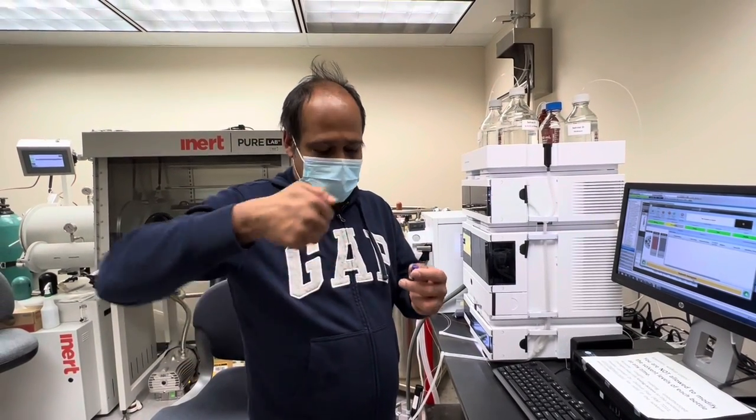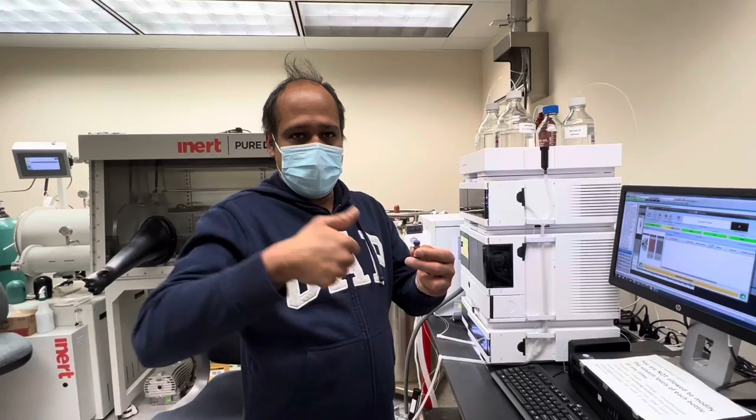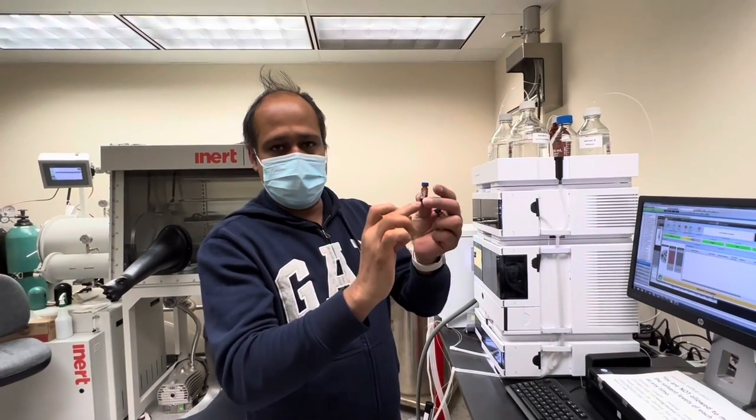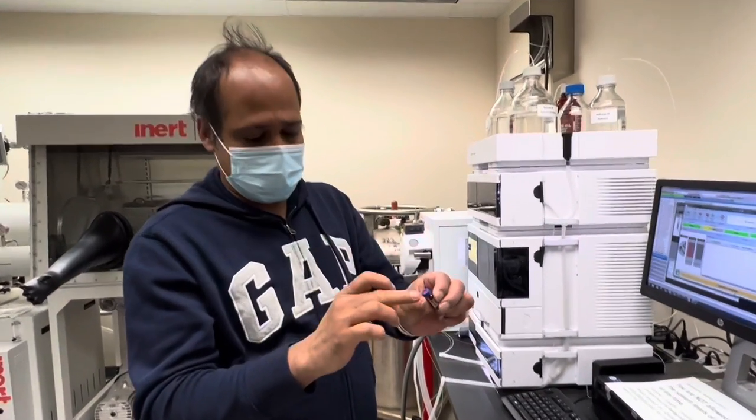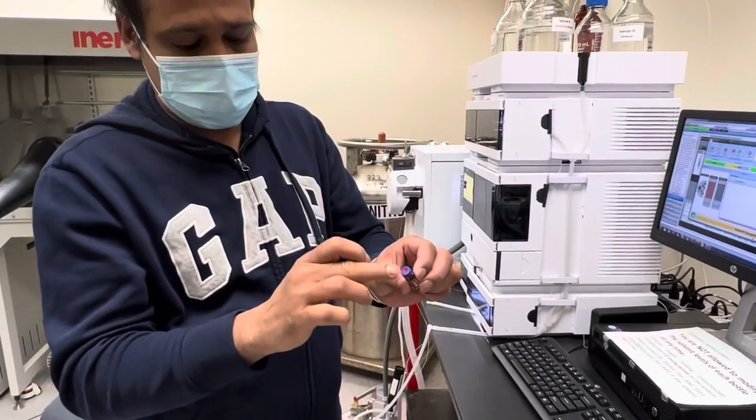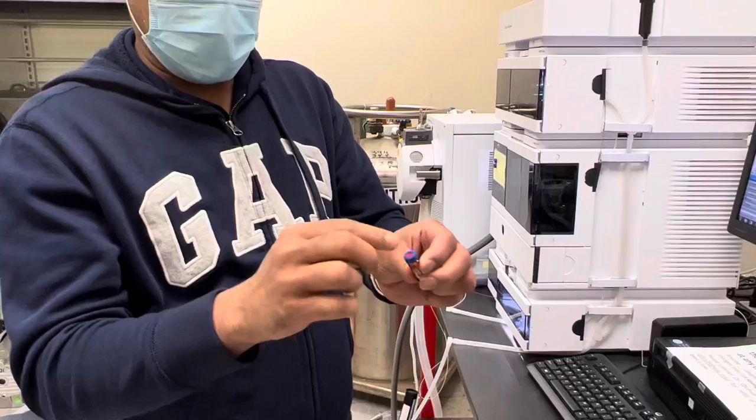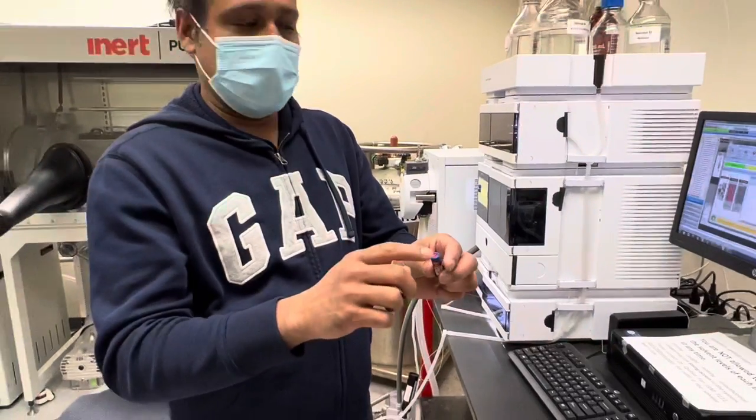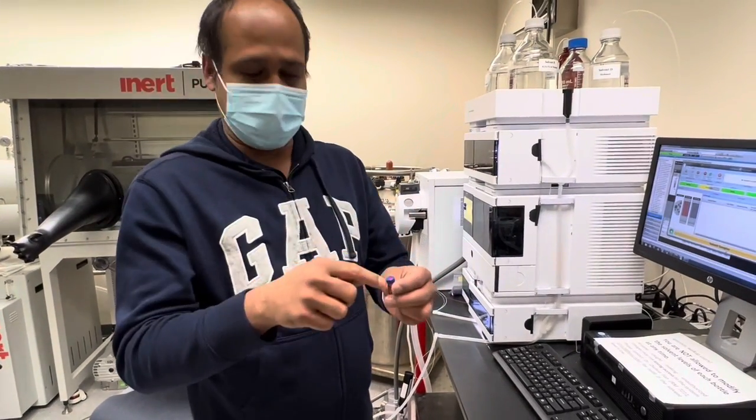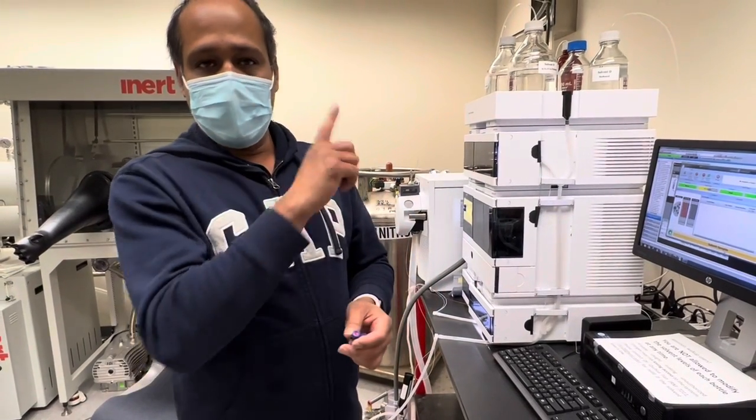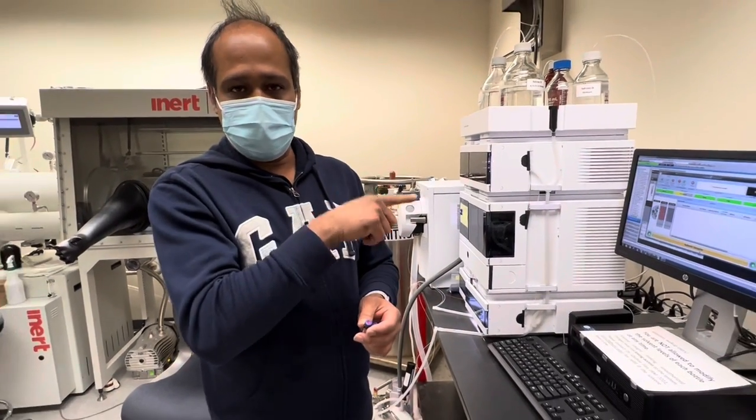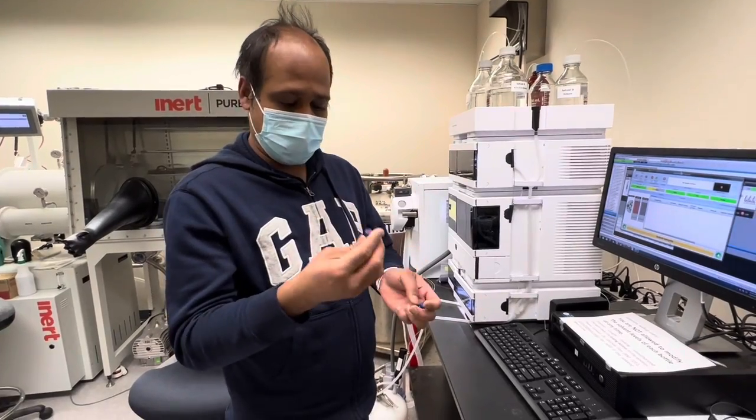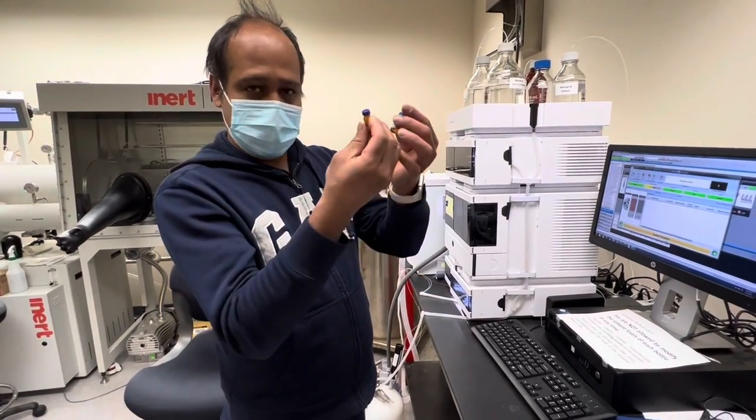We have the microfilter so you have to filter it in this vial and we have also a specific kind of cap because the needle is sensitive with the cap. So you made the sample, you come here and first thing is this.